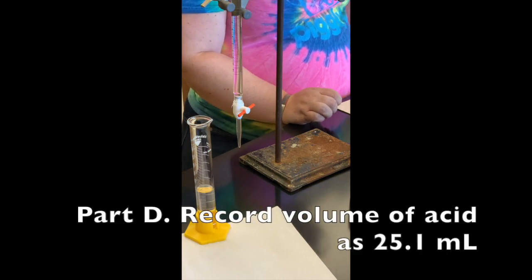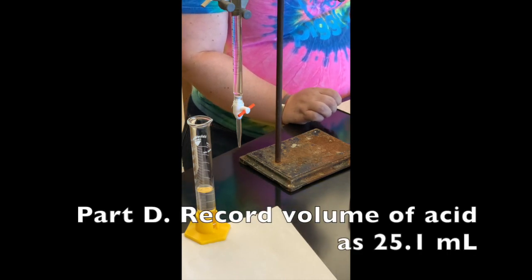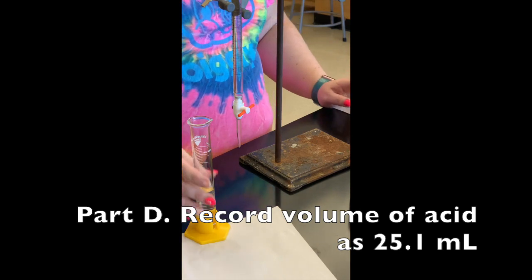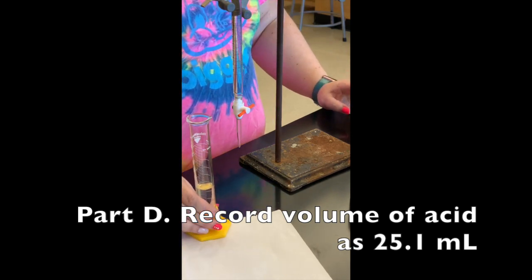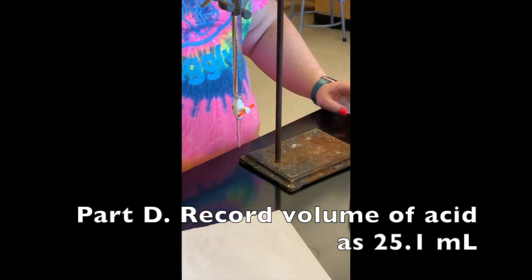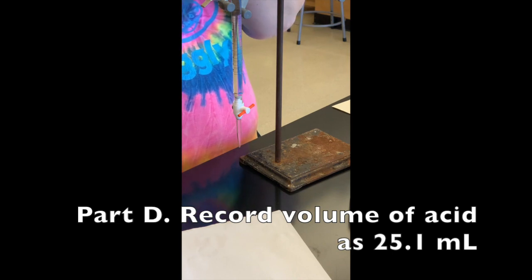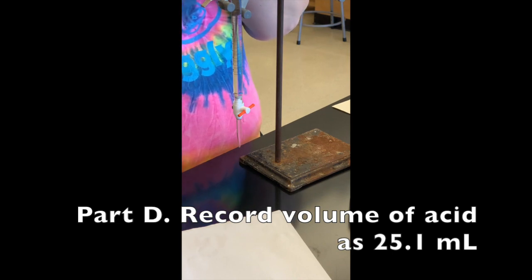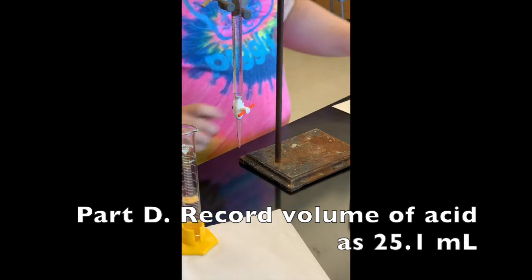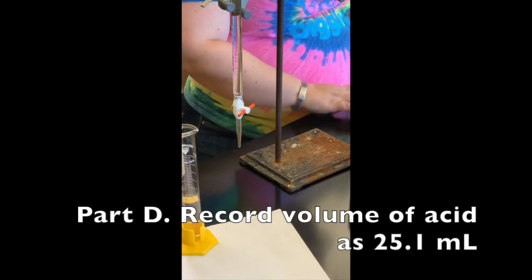On Part D of your report sheet, the volume of our unknown acid is going to be 25.1 milliliters.